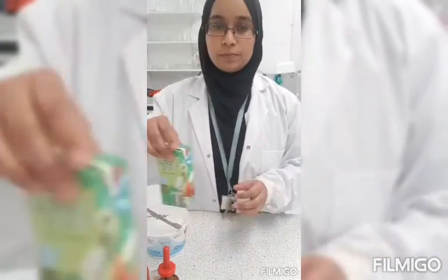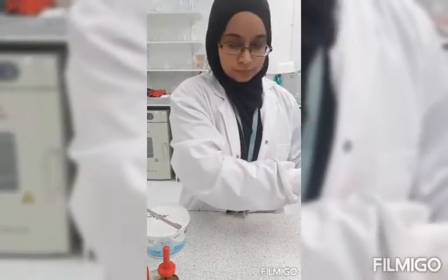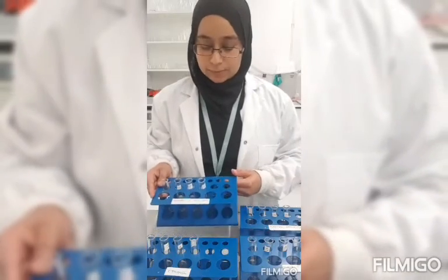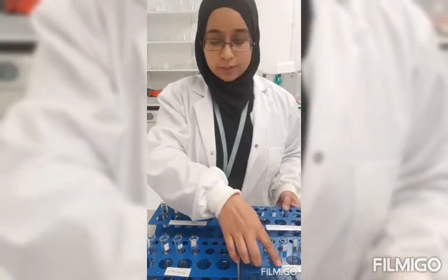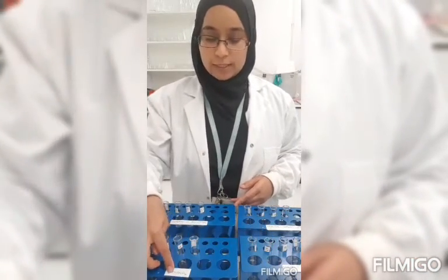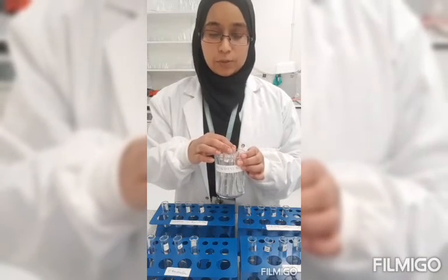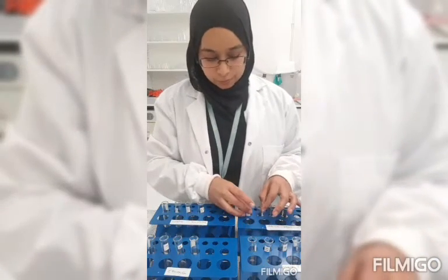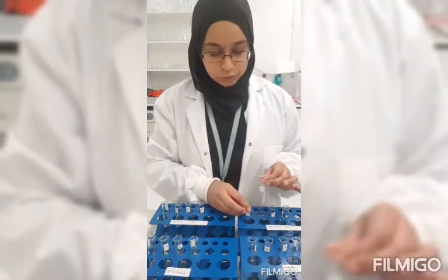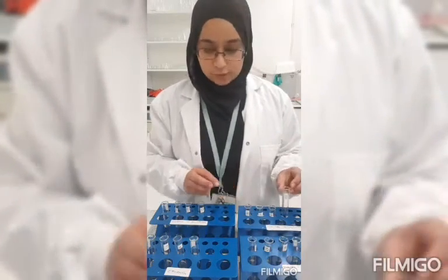Now for the juice — you don't really need to do anything with that, or the olive oil, because they're already liquids. What I've done with my test tube racks and test tubes is labelled them. So I have test tubes for iodine solution, biuret solution, Sudan III solution, and ethanol solution. I've also labelled my test tubes with initials of the food: B for biscuit, S for sugar, A for apple juice, and O for olive oil.